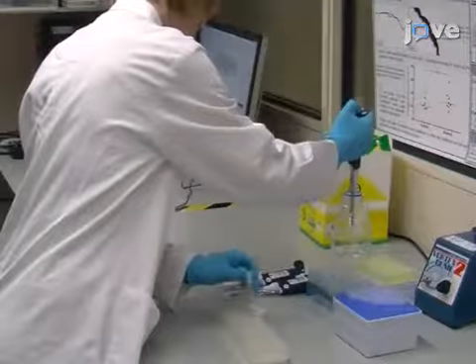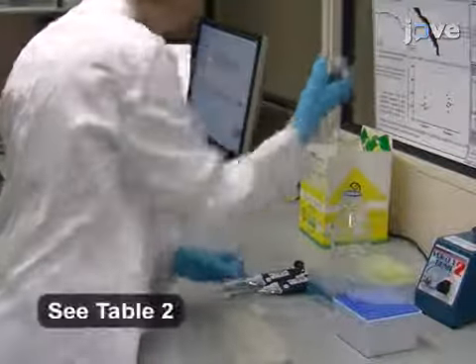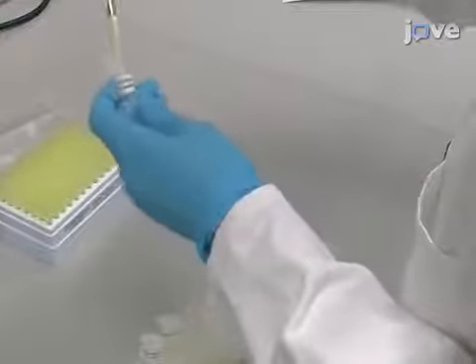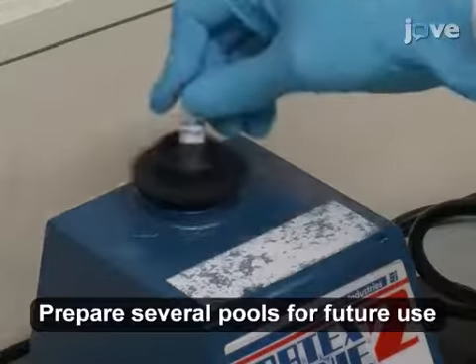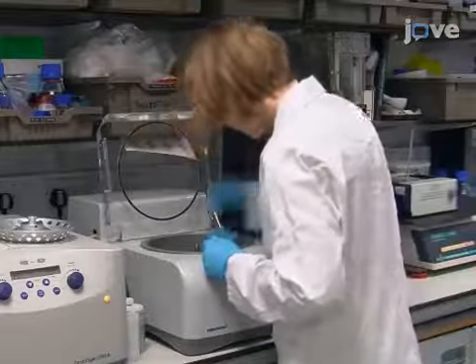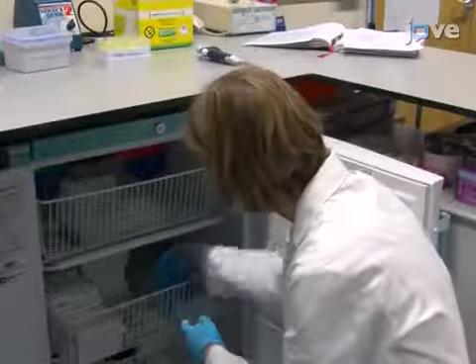To begin this procedure, resuspend the desired synthetic peptides to a 1 mg per milliliter stock concentration according to the manufacturer's instructions. Prepare 1 in 10 dilutions of the peptide from the stock concentration and pool 1,000 picomoles of each peptide into a low-binding microcentrifuge tube. Dry the pooled peptide sample in a speed vac concentrator. When finished, store the sample at -20 degrees Celsius.